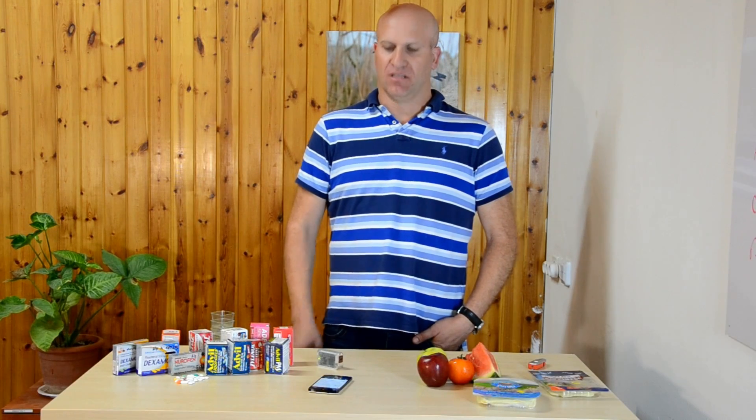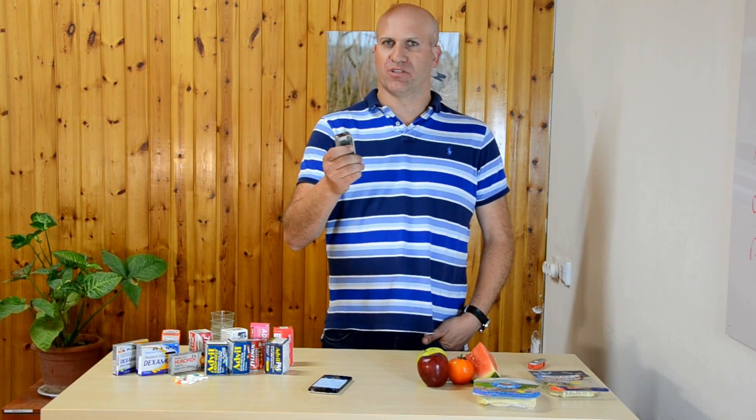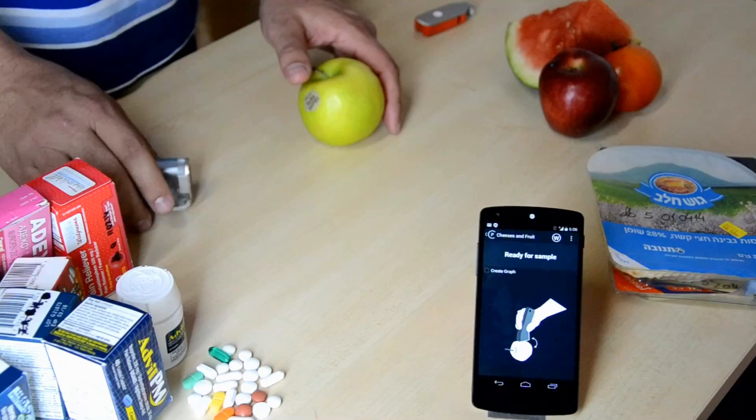Hi, my name is Damian Goldring, CTO and Co-Founder of Consumer Physics. I will now show how our current prototype works.